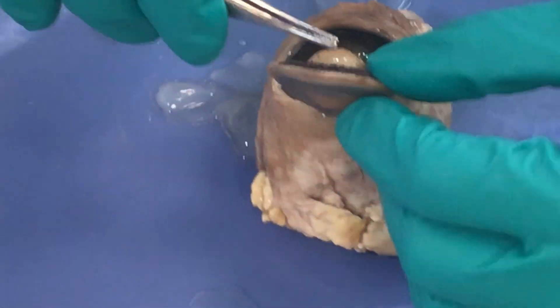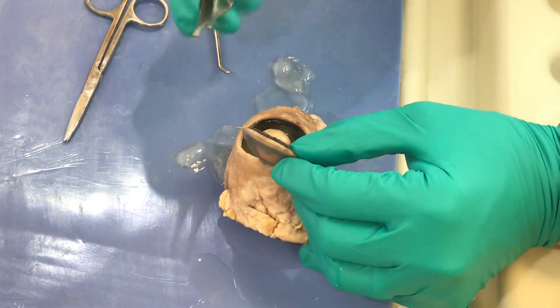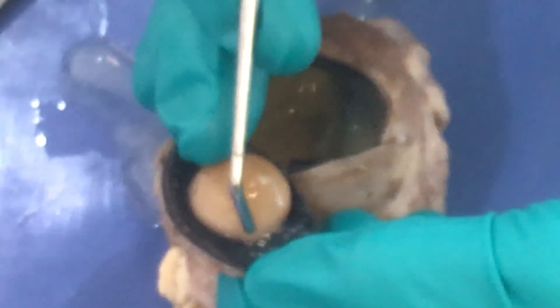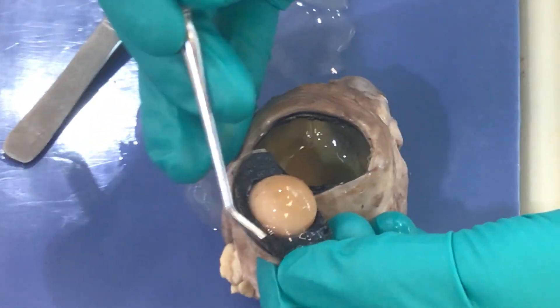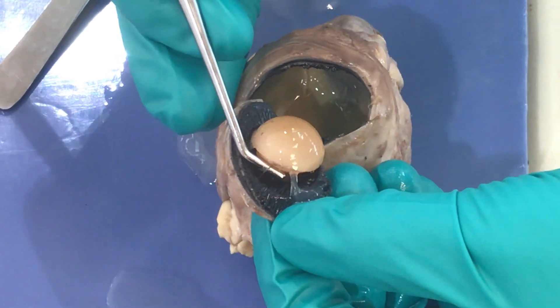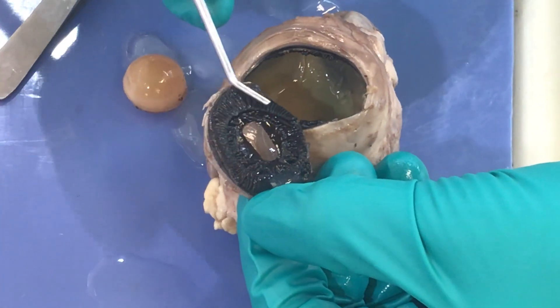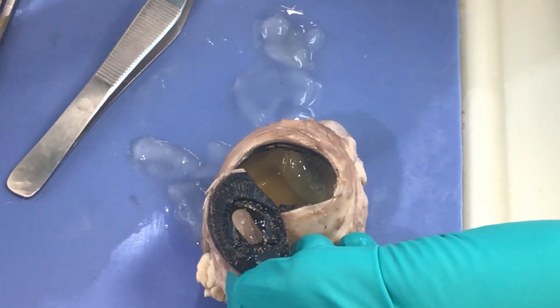Anything in front of the lens is called the anterior cavity; anything posterior to the lens is called the posterior cavity. Now I'm going to remove the lens. As I remove it, you're going to see little fibers tearing — these fibers are attached to the ciliary muscle. These are the zonular fibers. Those are what hold the lens in place, and as the ciliary muscle contracts or relaxes, it changes the shape of the lens, allowing us to focus up close or far away.